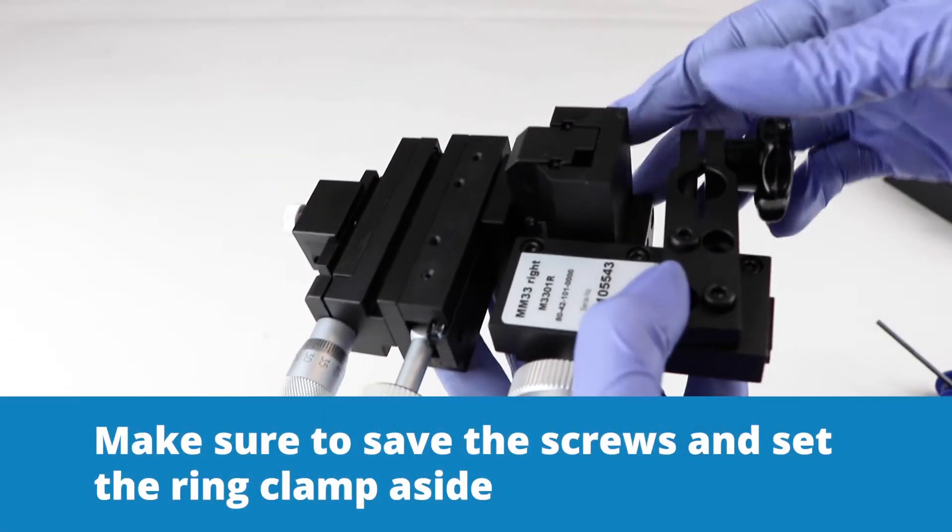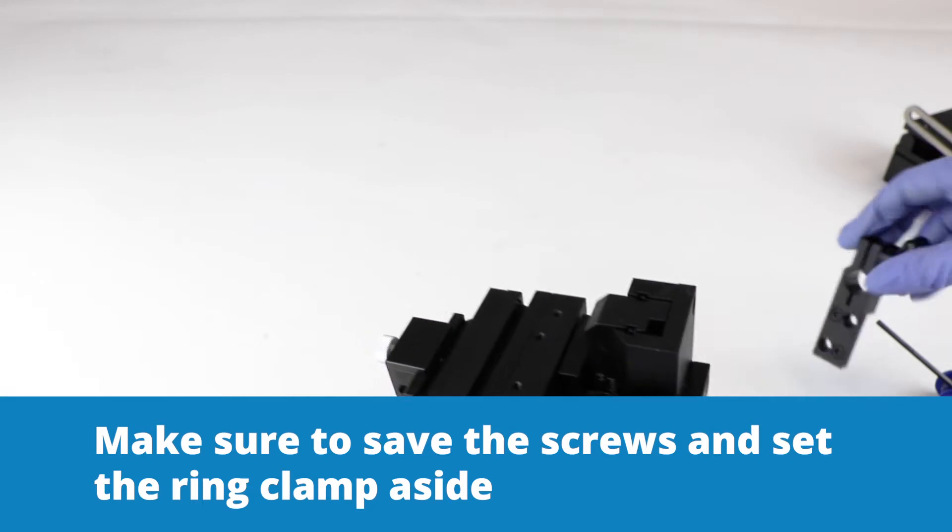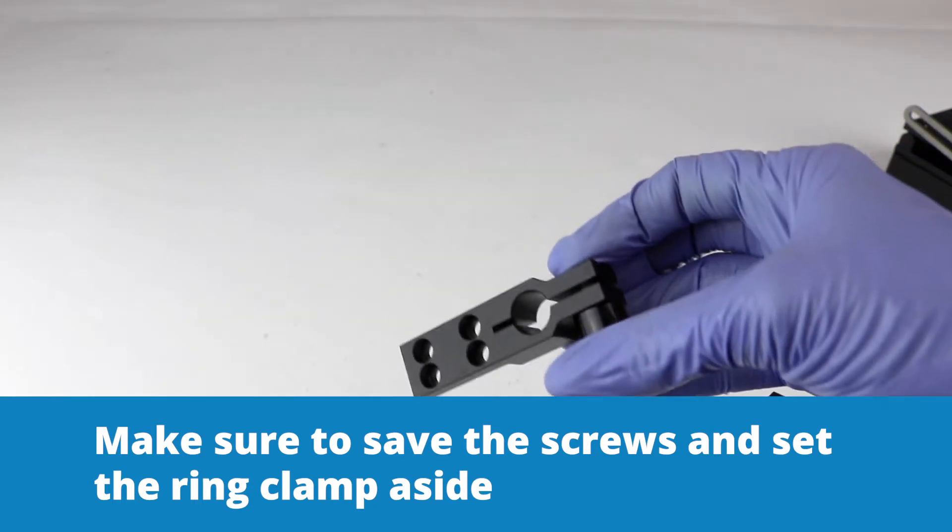Now save the screws. We're going to use them in a minute, and we'll set the ring clamp aside.